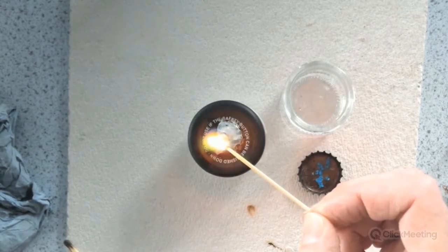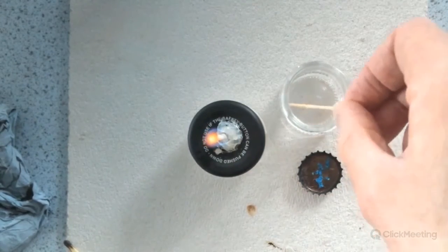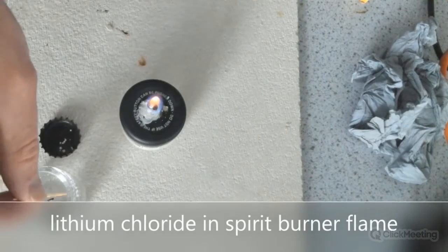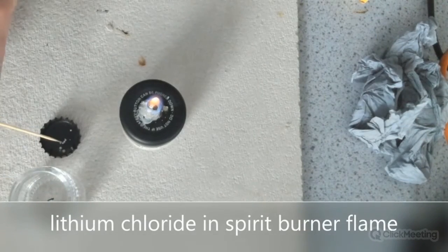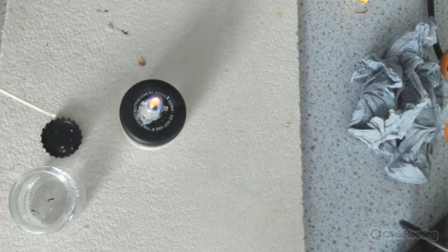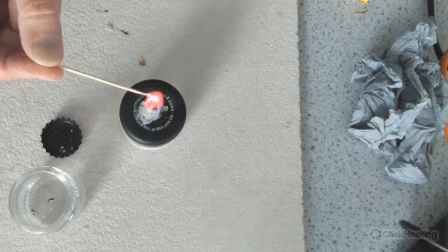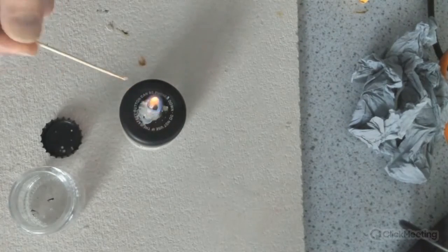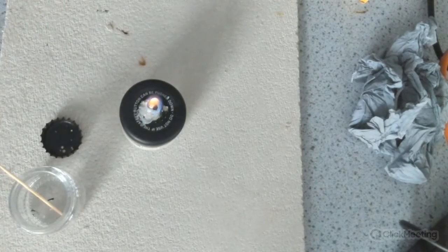So the exposure to copper sulfate is very minimal here. This can also be done with lithium chloride if you want to do it, and various other salts for flame tests. So again, moisten the stick, add a grain or so of lithium chloride, and simple flame tests can be done. It doesn't work so well for things like potassium, but you can get reasonably good colors with strontium and various other salts as well.